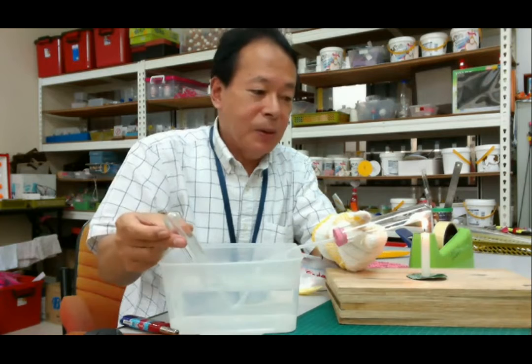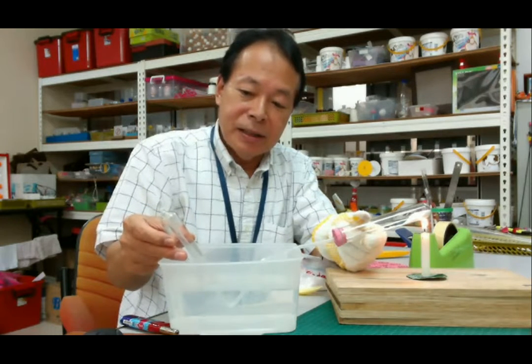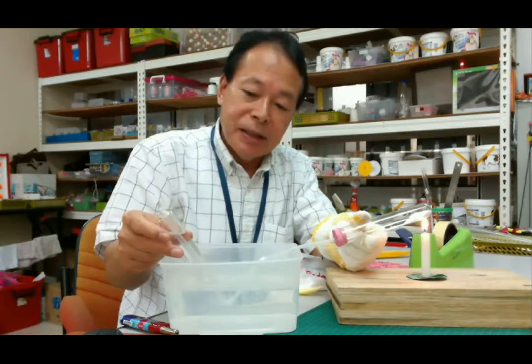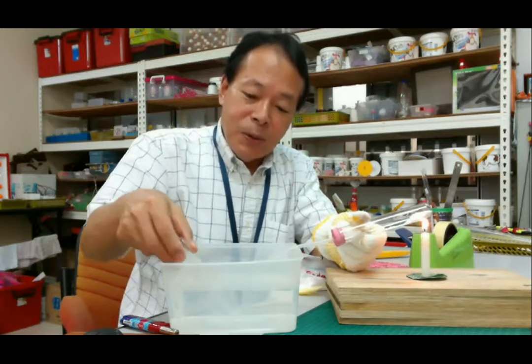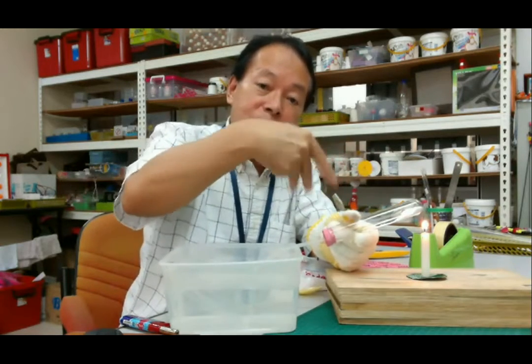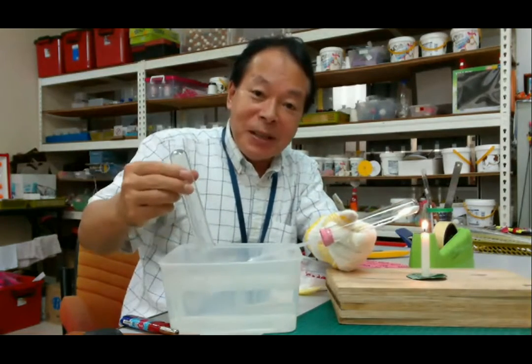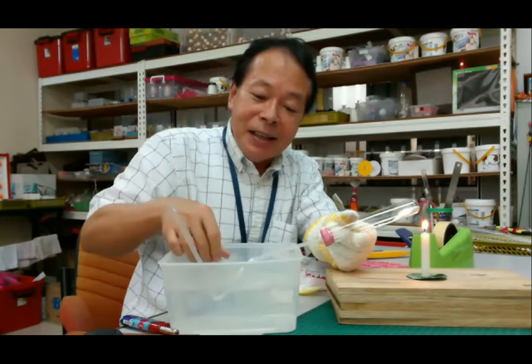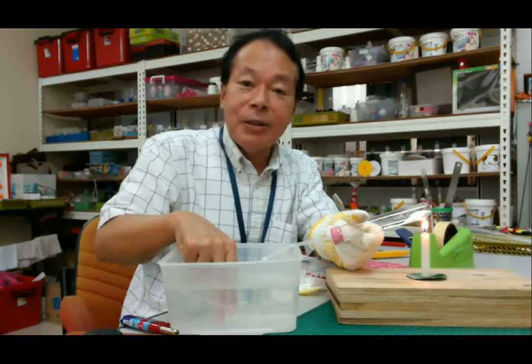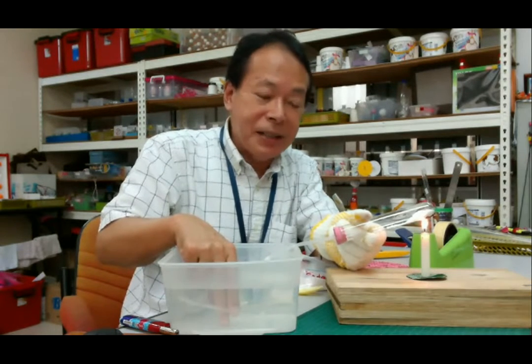Okay, so can you see the bubble is coming? So water level is going back. Okay, so before that, inside of the test tube in advance, there's some air. So we have to push the air outside. So before collecting the carbon dioxide, first we have to remove the air to the outside. So we have to wait before collecting the carbon dioxide.